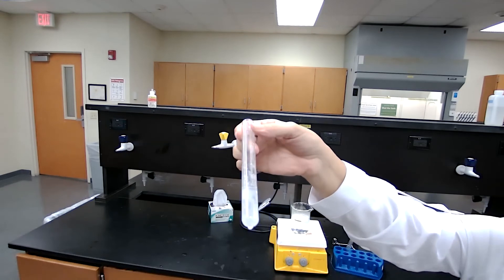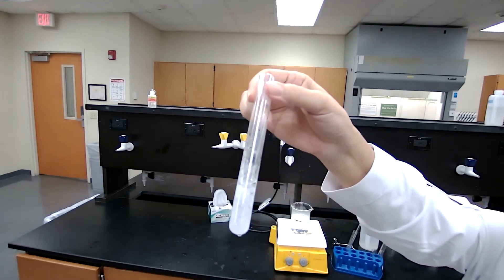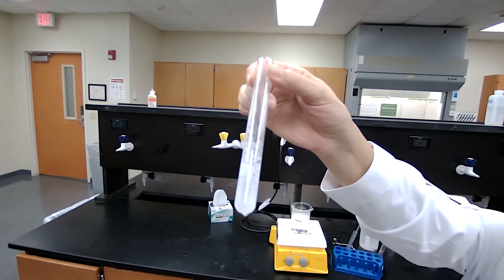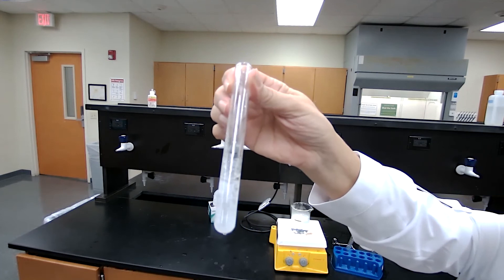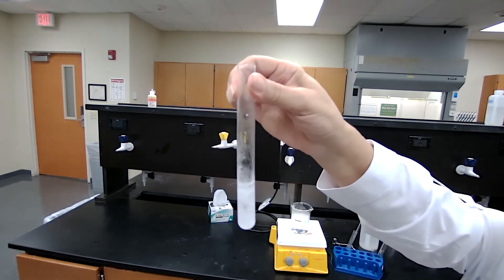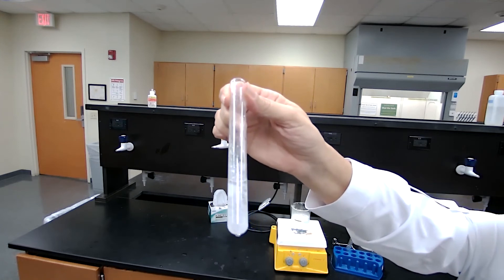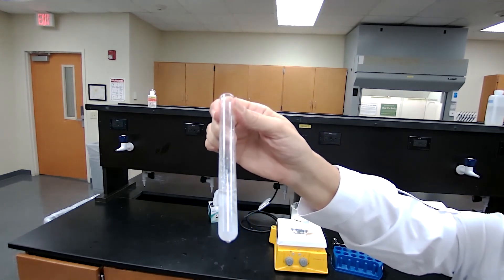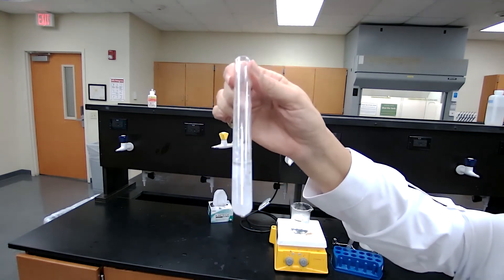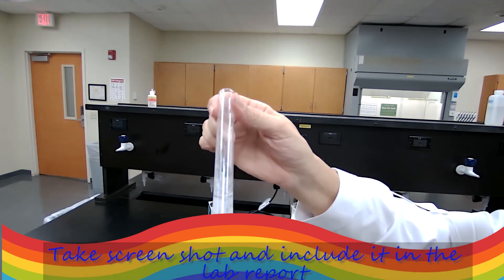The solution has cooled down to room temperature, and you can see that the crystals of the sample have appeared at low temperature. This makes water the right solvent to use. We cannot use ethanol because it dissolved the sample at room temperature.